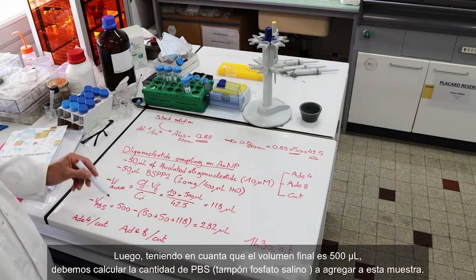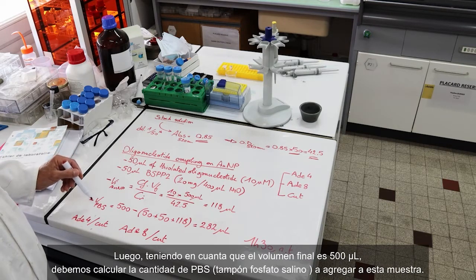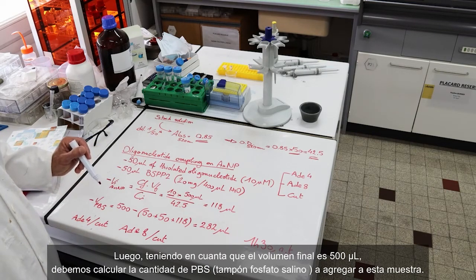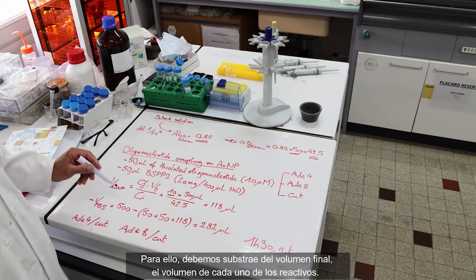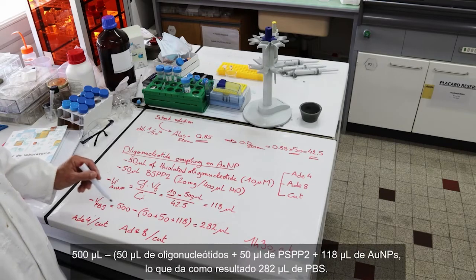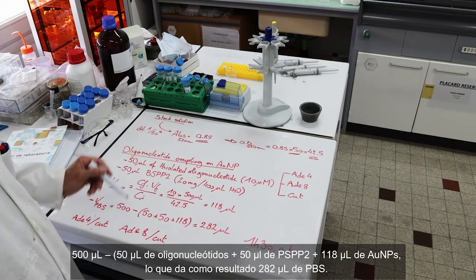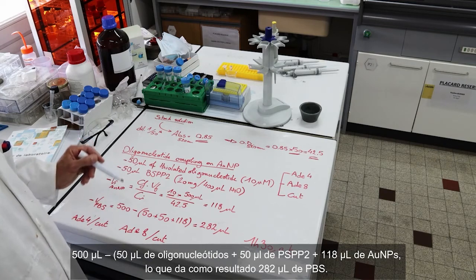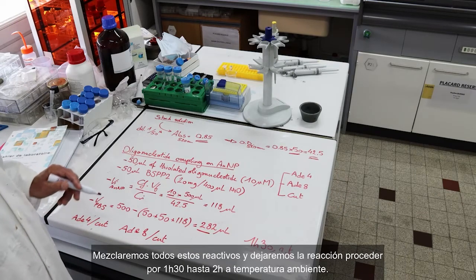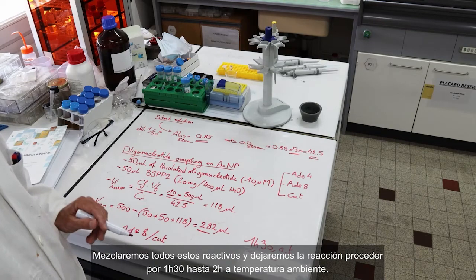And then, because the final volume is 500 microliters, I have to calculate the amount of PBS, phosphate buffer saline solution, to add to this mixture of reagents. To do that, I subtract the volume of each of the components from the final volume: 500 minus 50 microliters of oligonucleotides plus 50 microliters of BSPP2 plus 118 microliters of gold nanoparticles gives 282 microliters of PBS. I will mix all these reagents and leave them to react on the bench for 1 hour 30 up to 2 hours at room temperature.